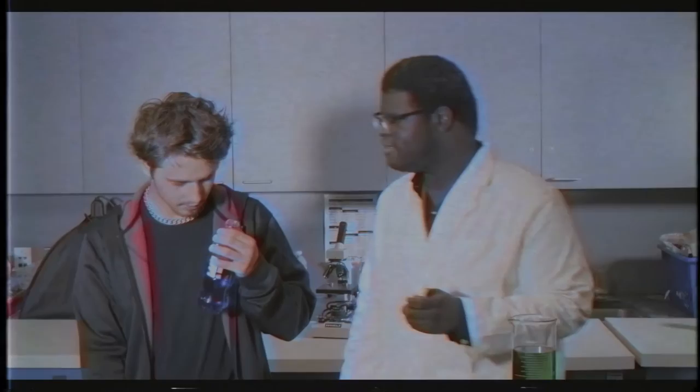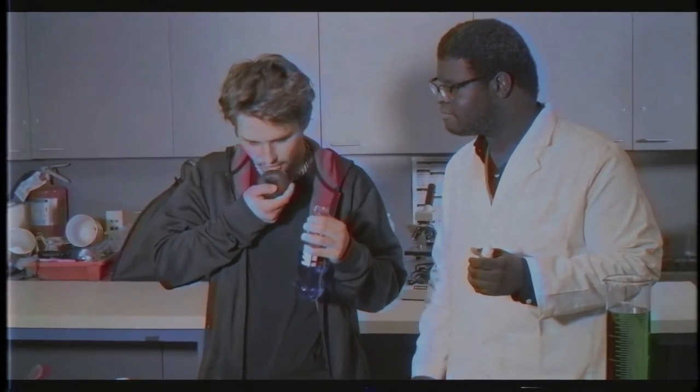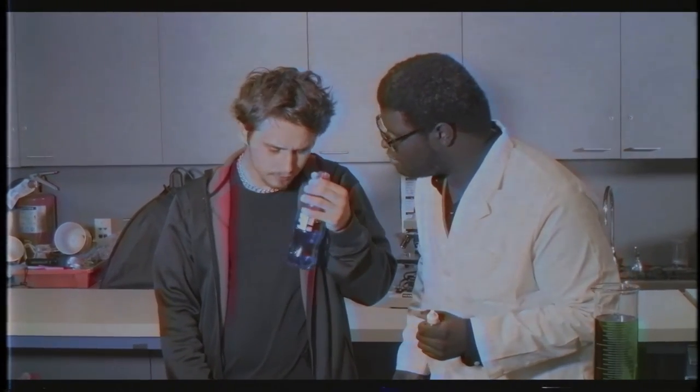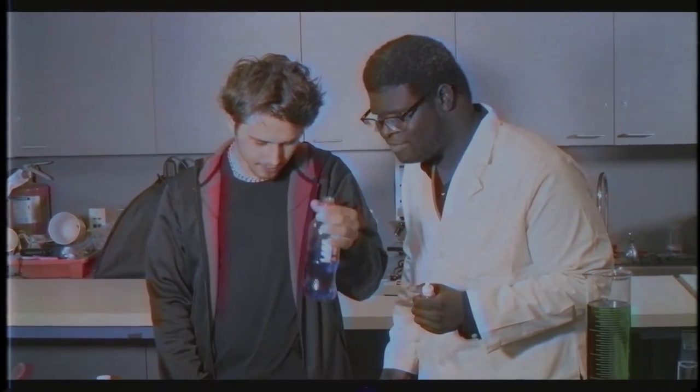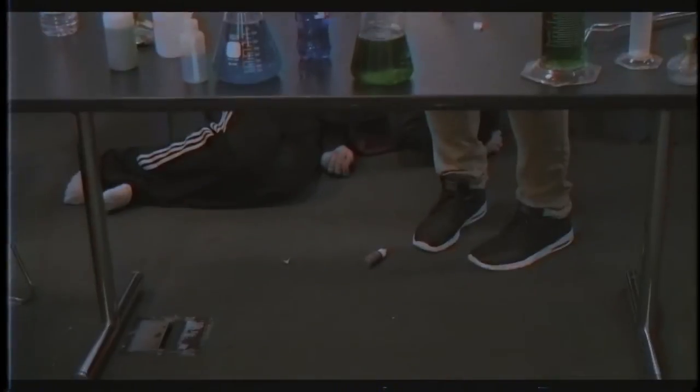This looks pretty good. Where did you get that? Just kind of found it lying around. You know, that drink kind of tasted like grape soda. Why do I even try? Rule number one, do not eat or drink in the lab room.